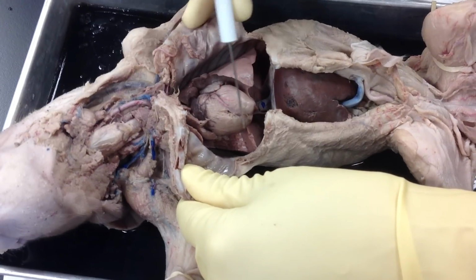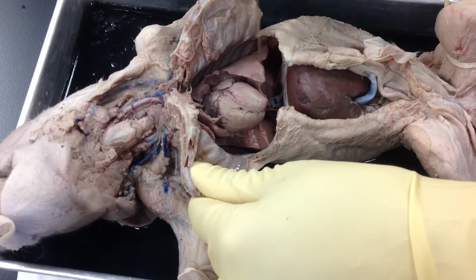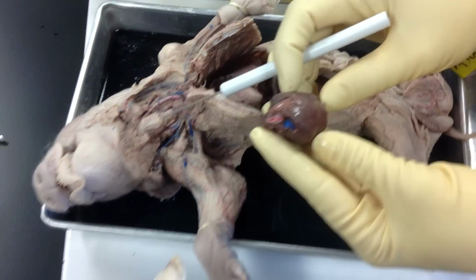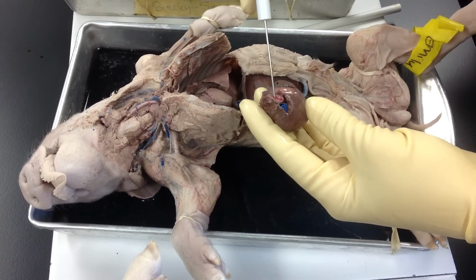This is the heart, and then, of course, surrounding the heart, we've dissected off a little here, are my lungs, okay? So these are the lobes of my lungs. So let's take a second and look at the heart. Here's a heart. So of course the red and the blue dye, blue being veins, red being artery.